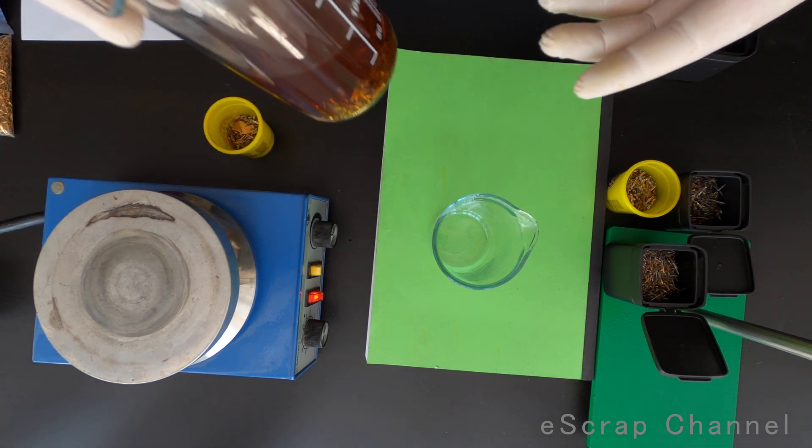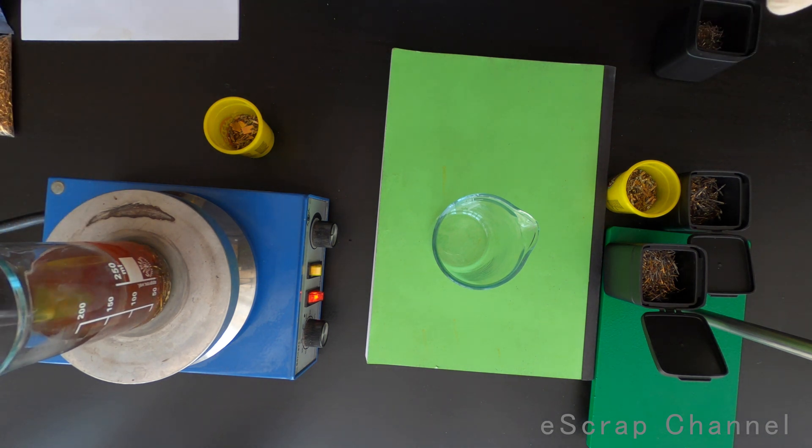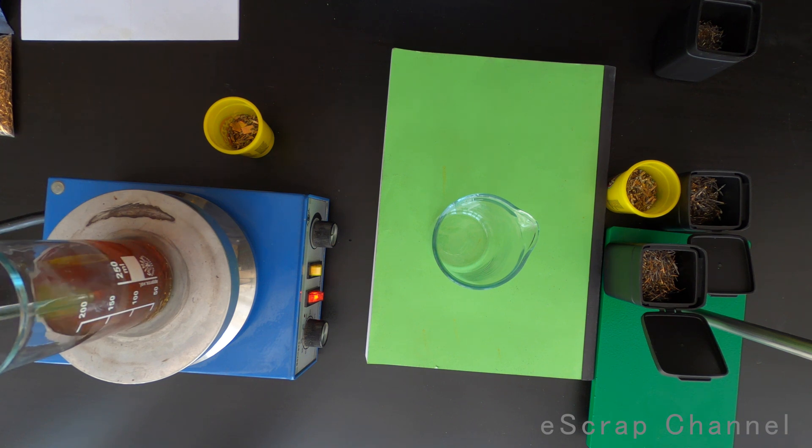Let me return it back to the heat plate and wait maybe a minute or two for the process to be fully complete. And I will then show you the pins, how they look like.